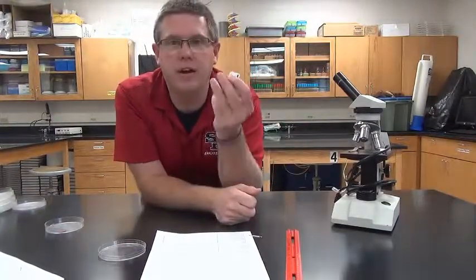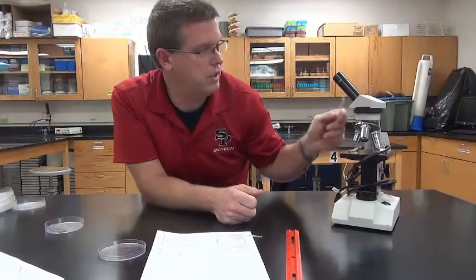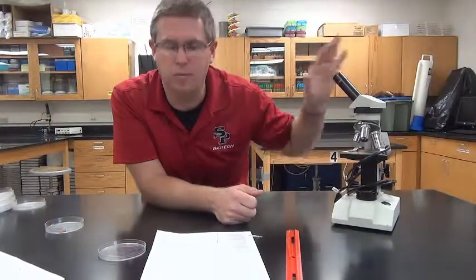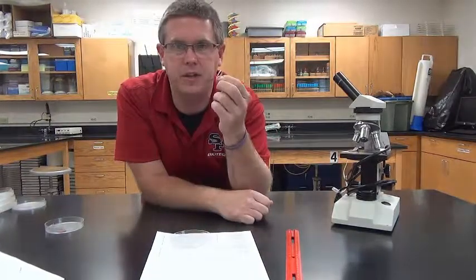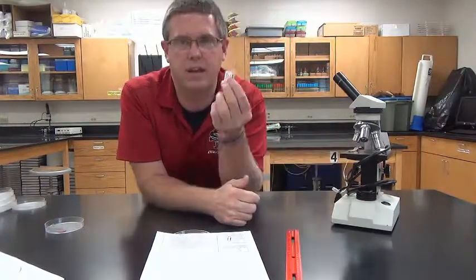We'll start with the microorganisms, and we'll use this because remember, when we look down the microscope we see a circle and an object in our field of view, and we'll be able to calculate the size of the microorganisms that I give you on the slides.